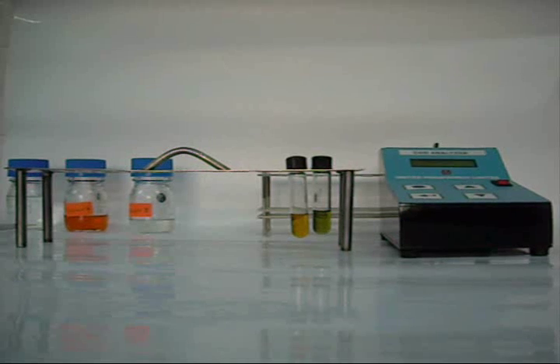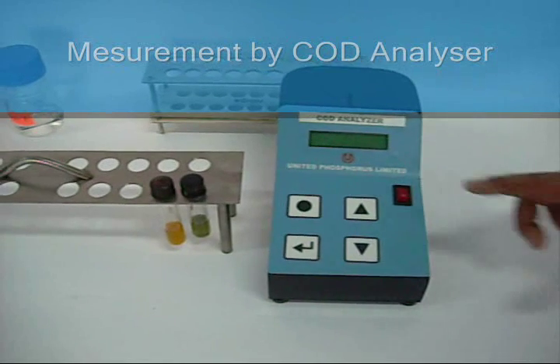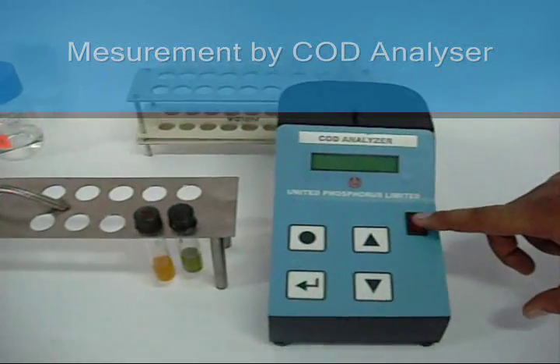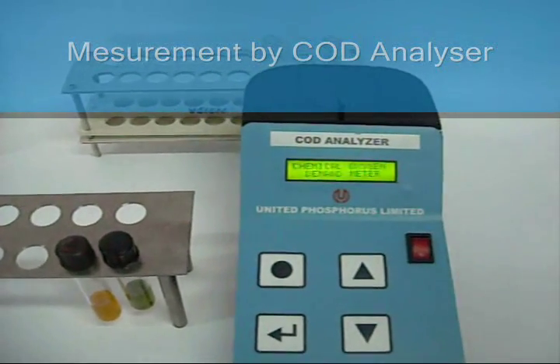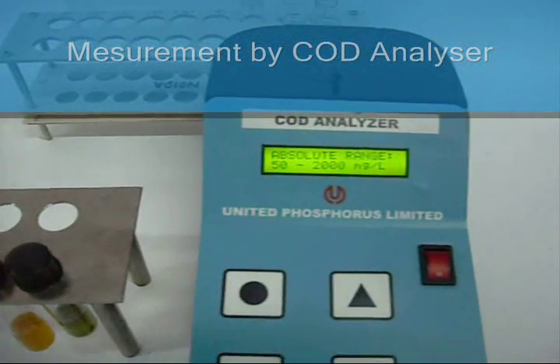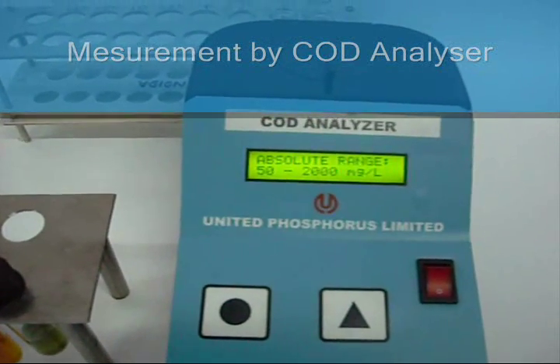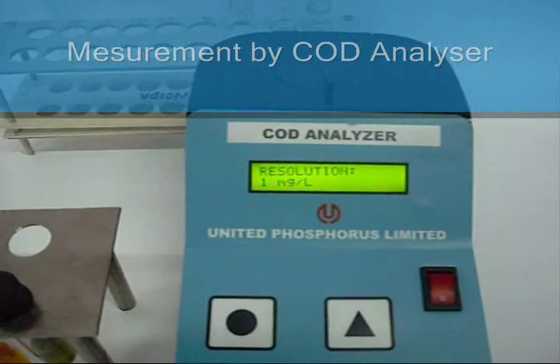Third step: measurement. The COD analyzer is a menu-driven instrument. Power on the instrument and follow the prompts shown on the display.